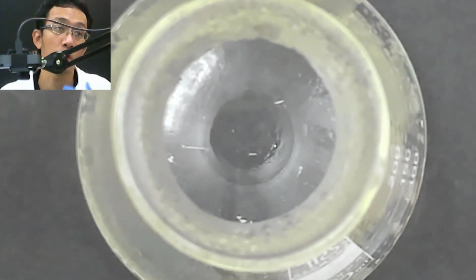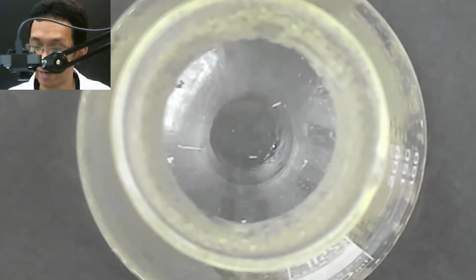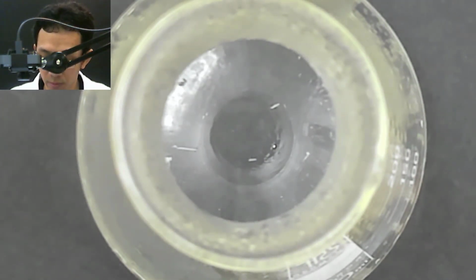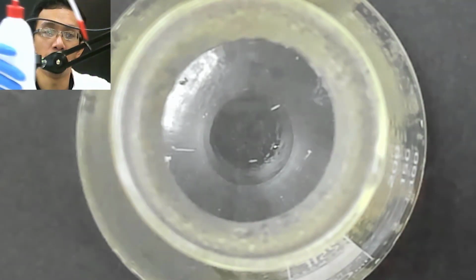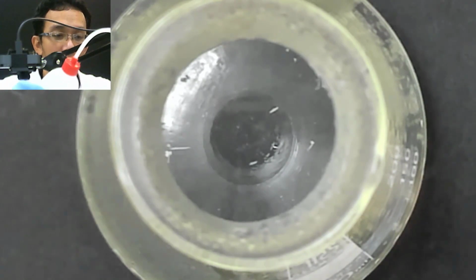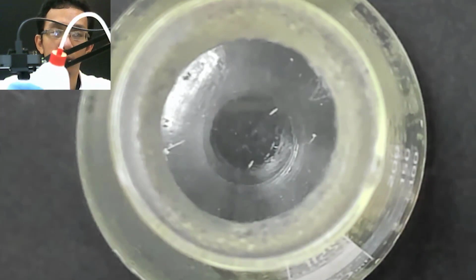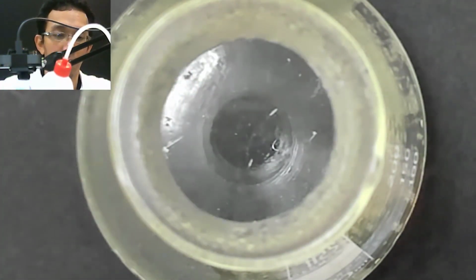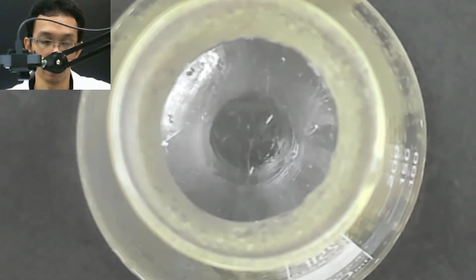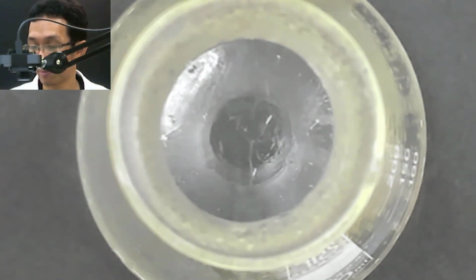See what happened. Now we cool it slowly. There are two ways to cool this. Either you put it in an ice bath, or you cool it like this, meaning you put it at room temperature. Look what will happen. The results are different when you cool like this and when you put it into the ice bath, something cold. Later we will show what happened. So now you look, something is happening there.